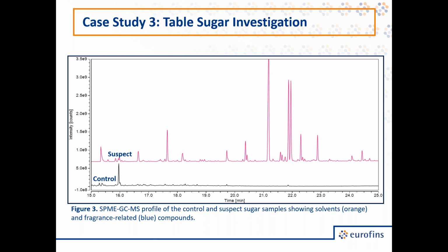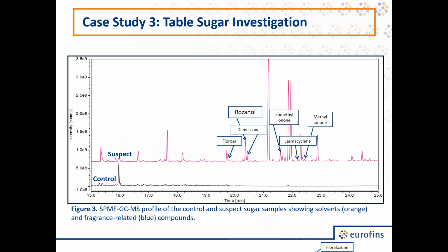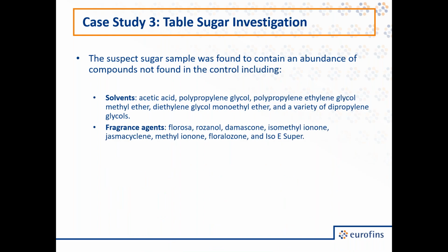And we were able to identify a lot of these. For instance, these peaks here were identified as solvents or related compounds, such as acetic acid, as well as a variety of different glycol-related products. As well, we also identified a number of fragrances. These are reported to have floral-like fragrances. And so, as I mentioned, the suspect's sugar sample was found to contain an abundance of compounds not found in the control, including these glycols as well as fragrance agents.